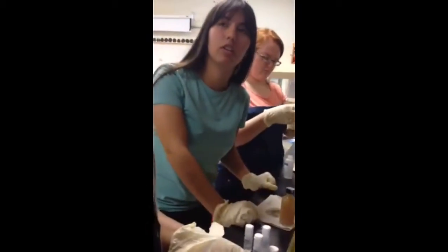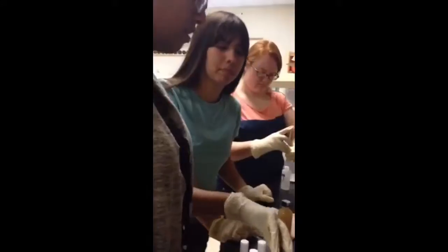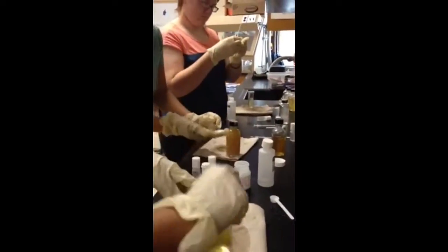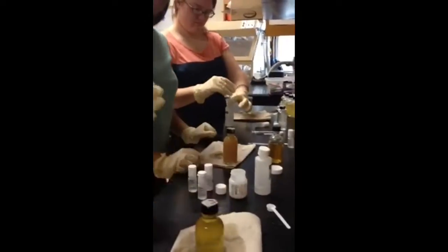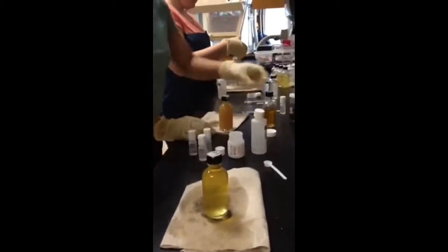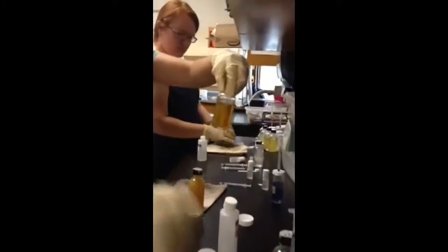We see a difference in the colors and the precipitate that forms. Yeah. The more sulfuric acid we added, the less cloud you get. So just wait for it to settle a little bit, at which point you would take this and pour it in this.